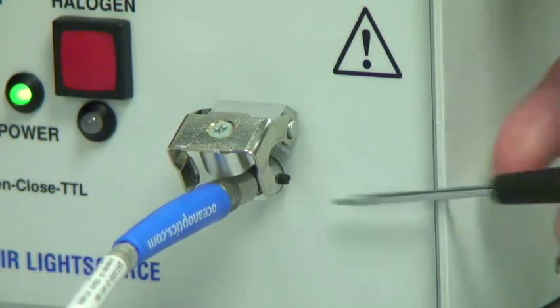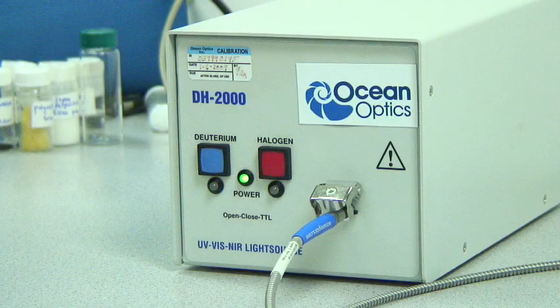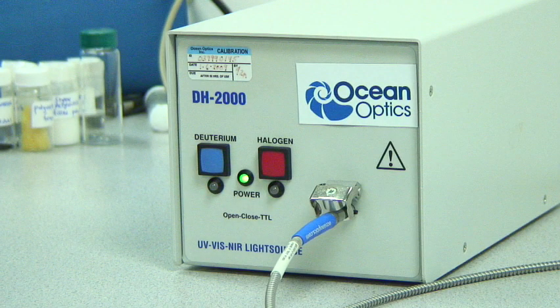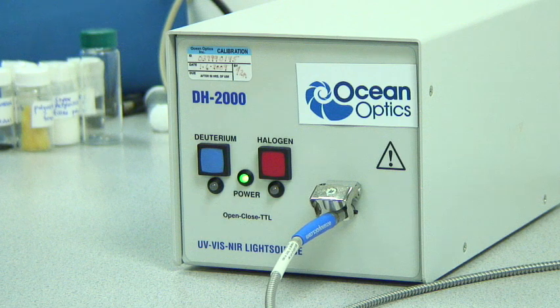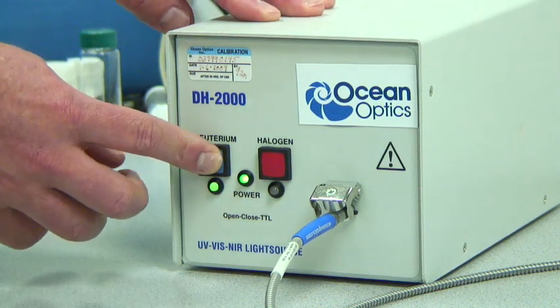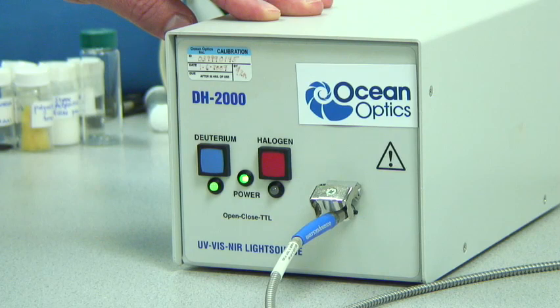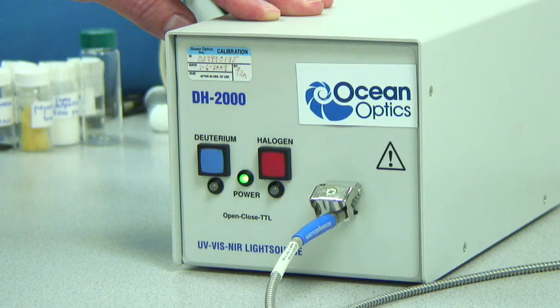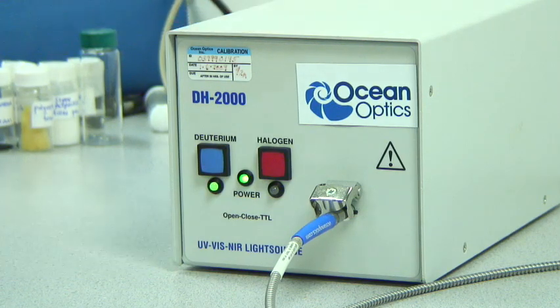When performing an absolute irradiance calibration of a UV vis spectrometer with a DH2000 cal calibration source, you only need to operate one lamp at a time during the calibration. First start the deuterium lamp by pushing the blue button on the front panel of the light source. You'll need to wait at least 20 minutes for the lamp to warm and to stabilize.